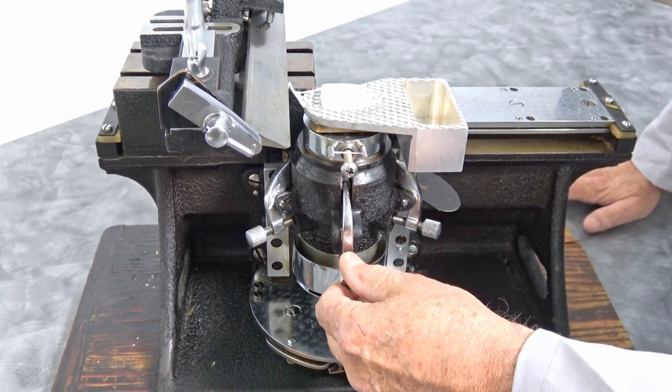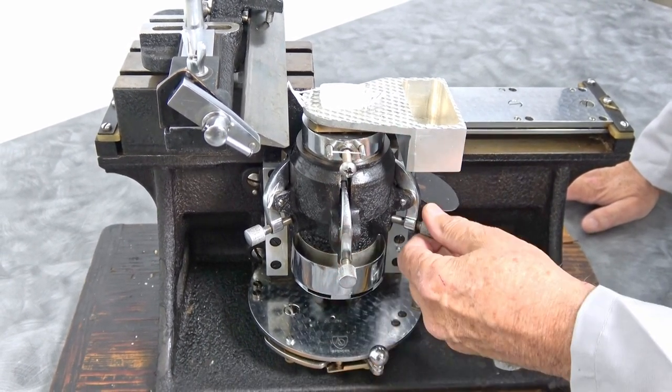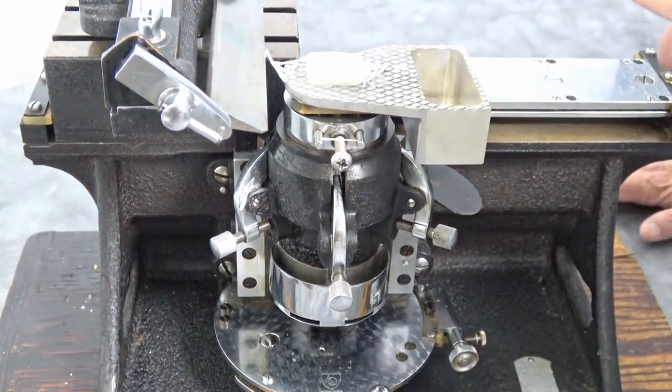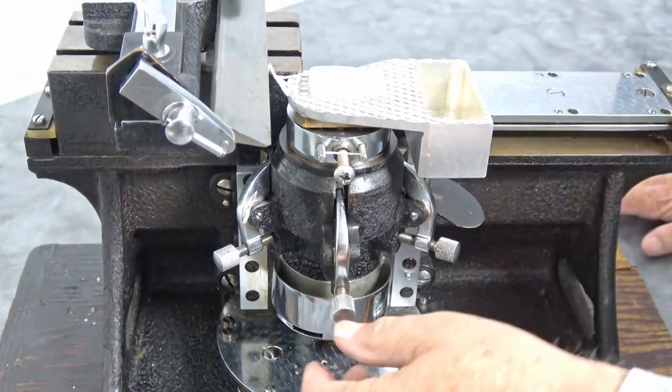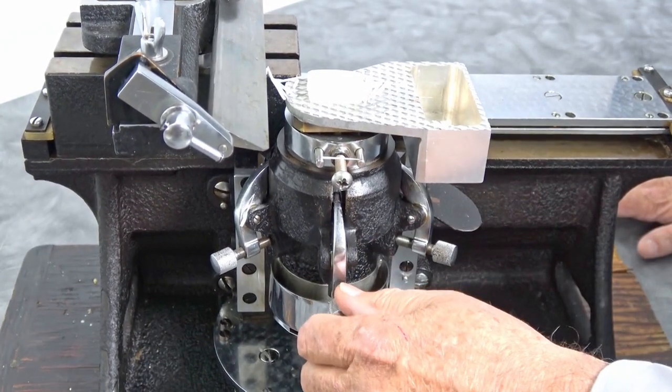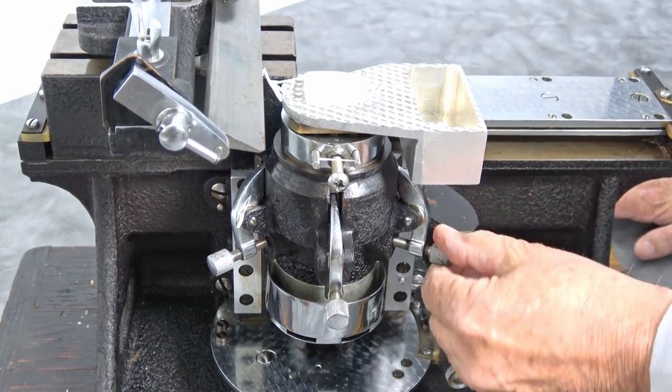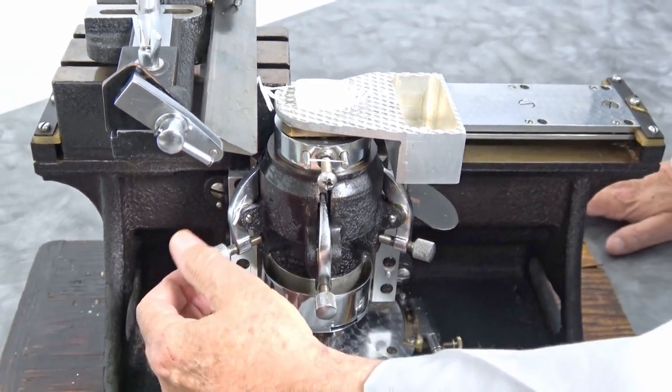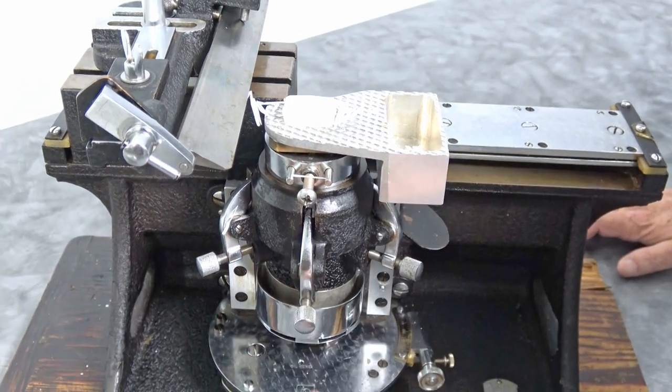By moving your levers there, I'm having to loosen because this is sort of a balanced system. You have to loosen some up to get others, and as you turn the screw you're seeing that move in various directions. So fully articulating.